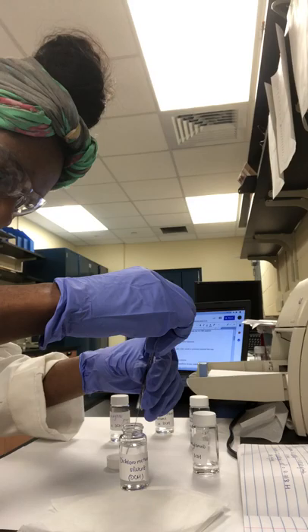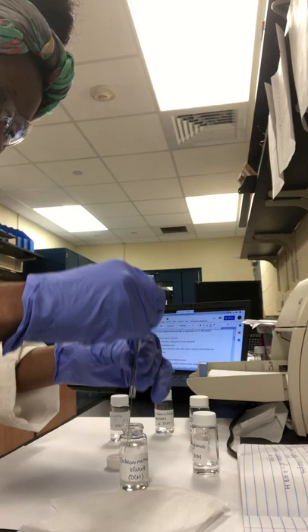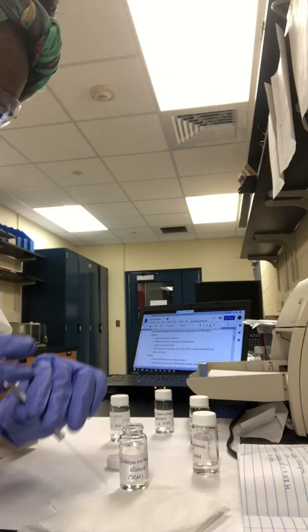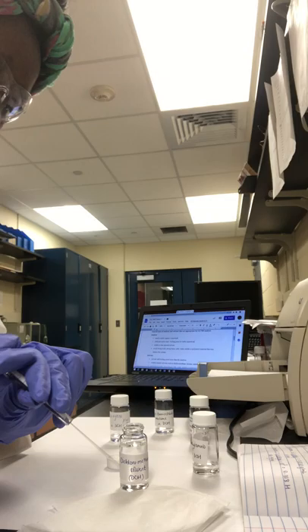We're going to insert the tip of our needle into the solvent, pull up a few microliters, and squirt it out of the syringe. We're going to do this at least five times to ensure that our syringe is clean. Fairly confident that this is clean.